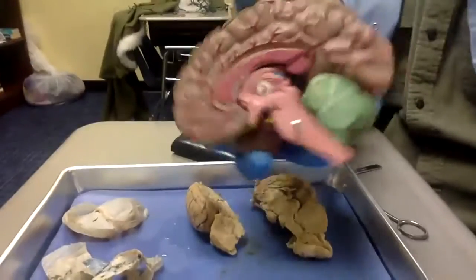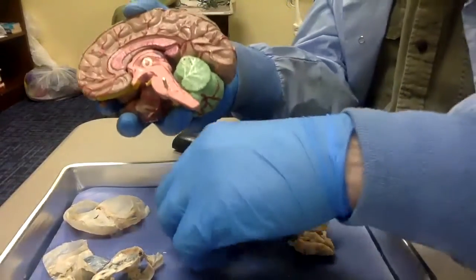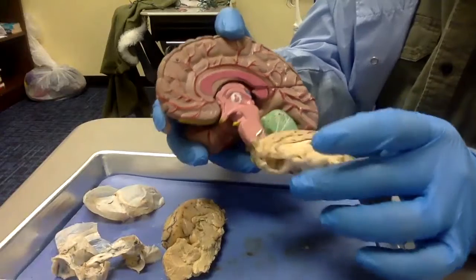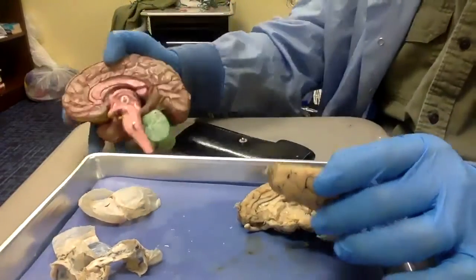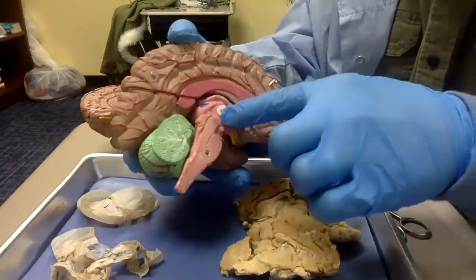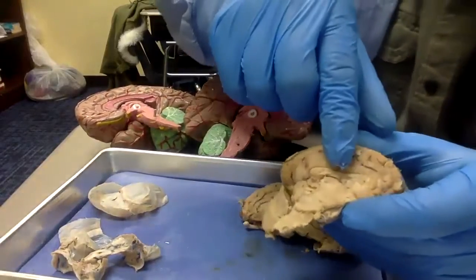The colors. We see the corpus callosum, what I was trying to show you, that would have connected the two sides. And we can see that very clearly in the sheep brain. It's a nice white layer right there, corpus callosum. And then underneath that, we can actually see better on this side, when I get the matching human brain. Underneath that, we have the thalamus and hypothalamus. And that's what we're looking at here under the corpus callosum.